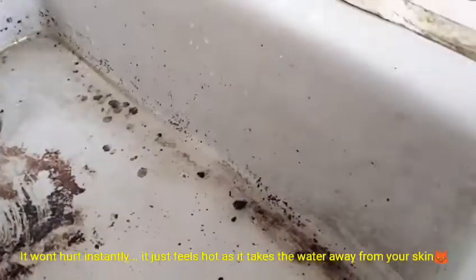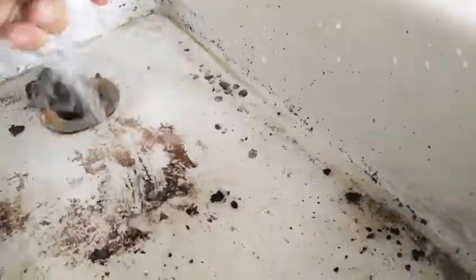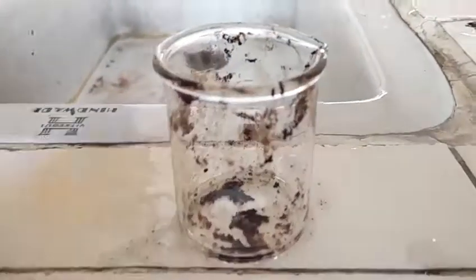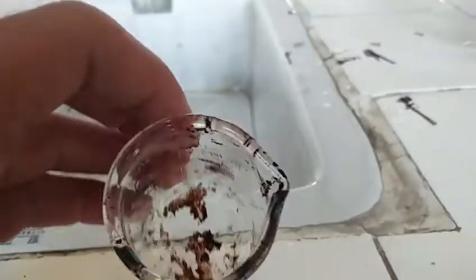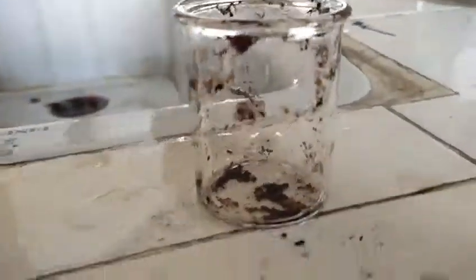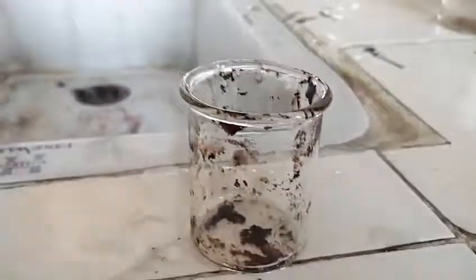Hey guys, welcome back to another chemistry group video where today I have something interesting to do with sugar and sulfuric acid. I already tried it, it works pretty good. So this is sugar. I did not powder it because I don't want the reaction to go out of control. It is sugar, I can eat it and it is sweet, obviously.